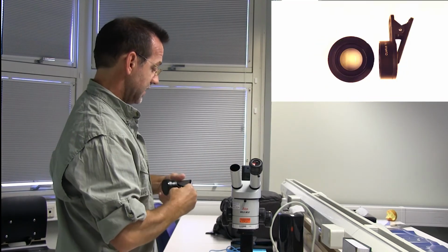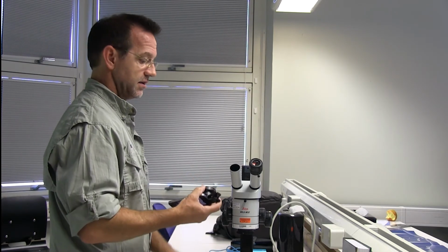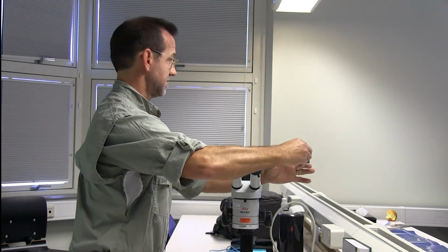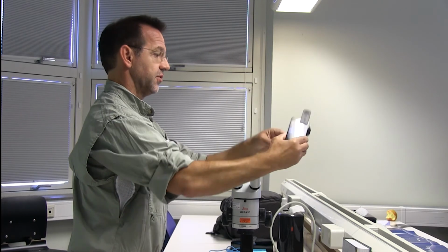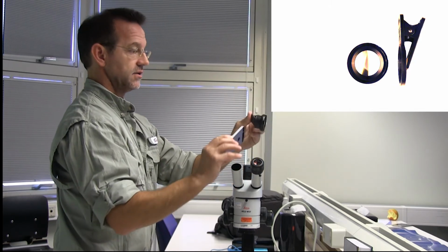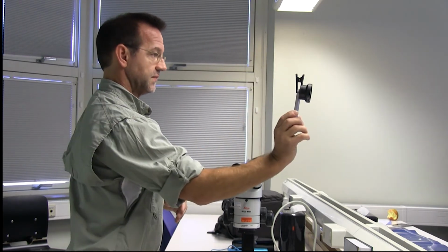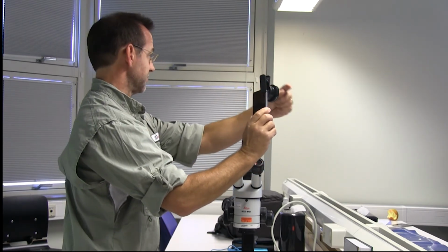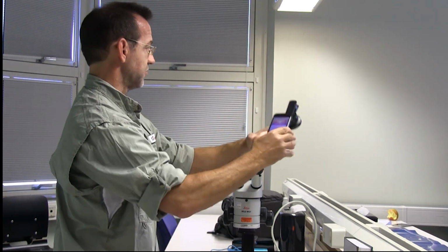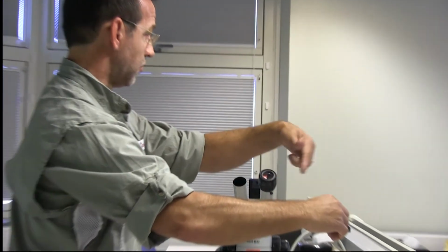So this is the most inexpensive way to have a good zoom for looking at a sample. Or for our purposes, one thing that can be a little bit of a stumbling block is taking your camera and getting a good picture of the whole disk when you have it in a sample dish. So this adapter has a wide angle and a macro lens on it. So when you put this on and you just line it up with the phone camera, and sometimes the phone camera's in the middle or on the side depending on which model you have. But the wide angle lens will help you get a picture of the whole disk, which is really nice. So you can get very, very close to the whole disk, get the whole picture there.